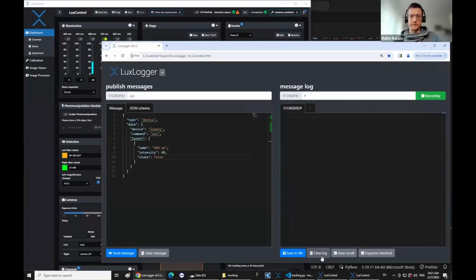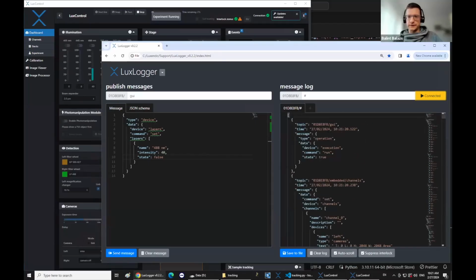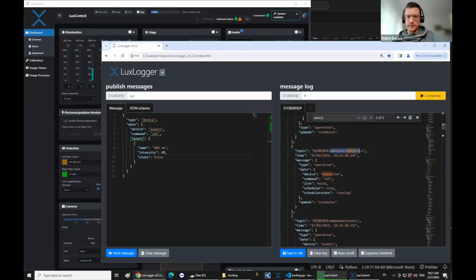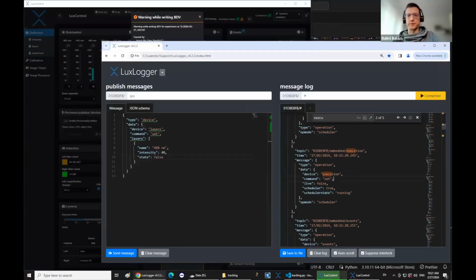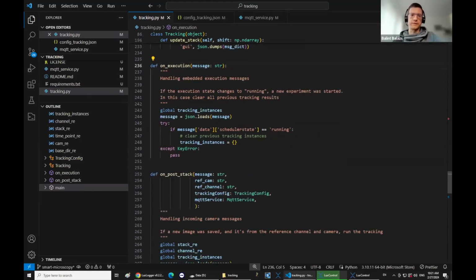So for example, if I now start run and I stop recording because there's a lot of things going on, we have a message here coming from the embedded system to this topic that I just showed, saying that now it's under the scheduler control. So scheduler is true and scheduler is running. Then when the experiment stops, you have some other flags set in here. So in this on execution, what you would do is just check if the scheduler state is running. That means that the new experiment was started, and basically just clear your tracking status in this case.